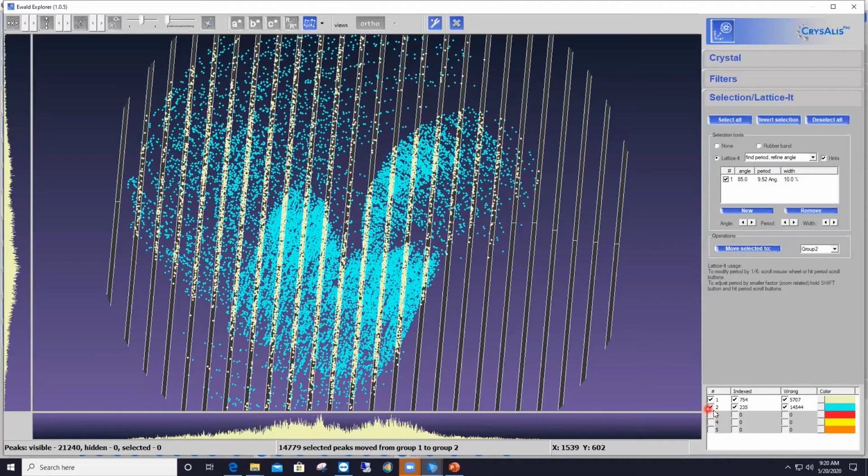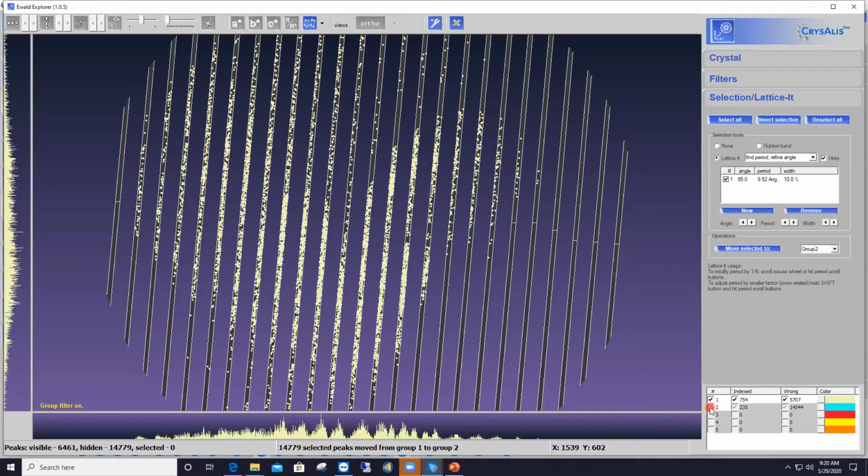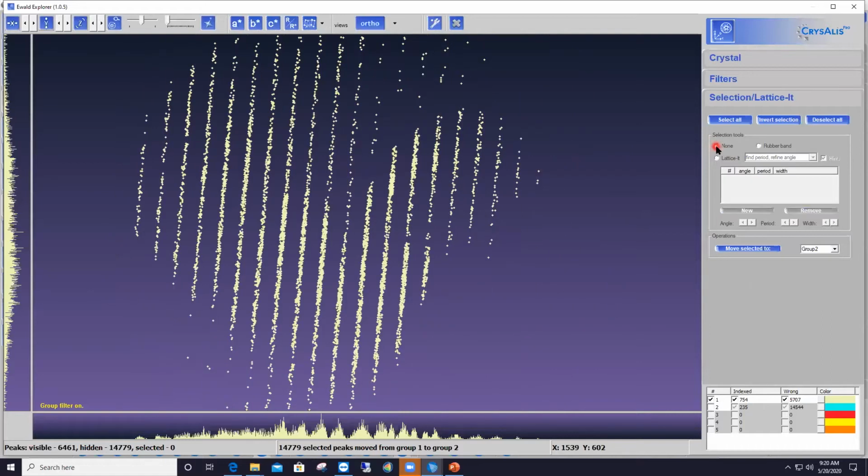Then I uncheck this box in front of number 2 to remove the group number 2 from the display. And I disable the Lattice-It feature by clicking on the None option. So that's what I've got here at the moment. So it's obviously already a much cleaner diffraction pattern.